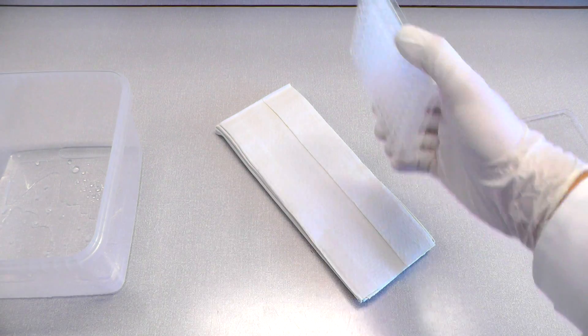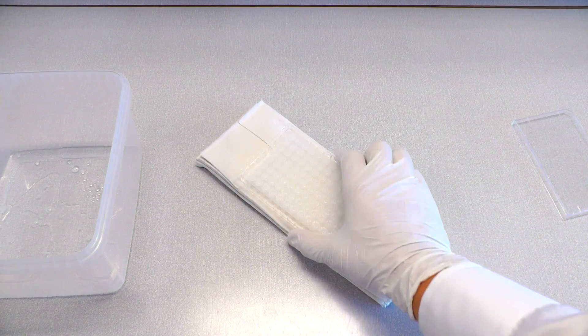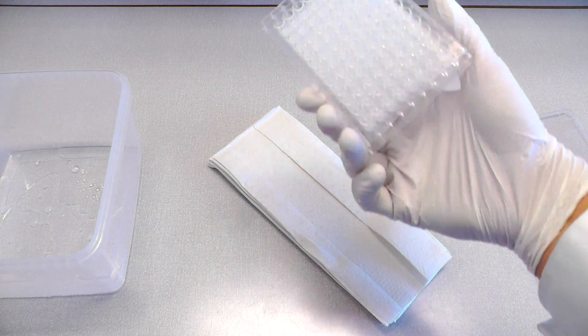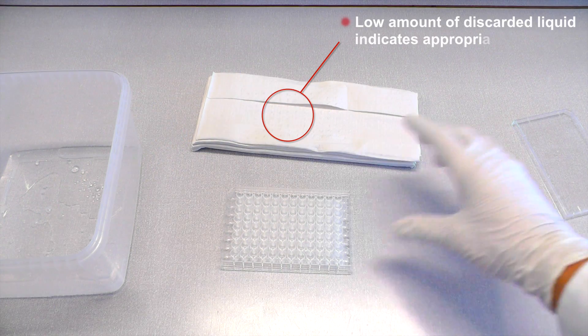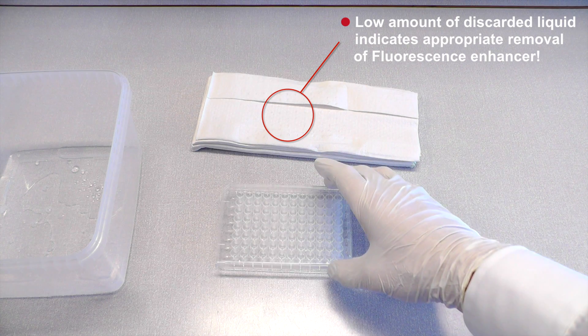If too much force is used during emptying, the under drain of the plate can be pushed back into the back side of the membrane and cause artifacts. Please pay close attention to the level of force the technician in this video is applying.